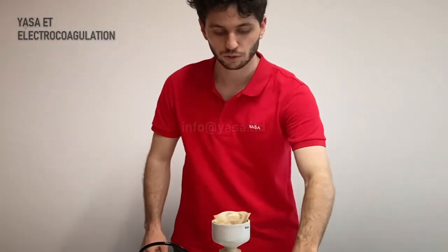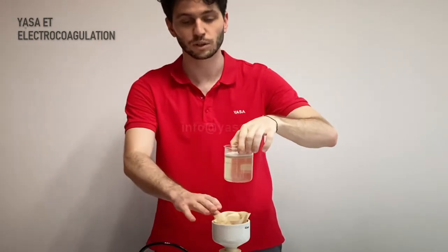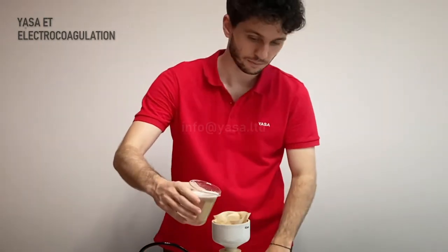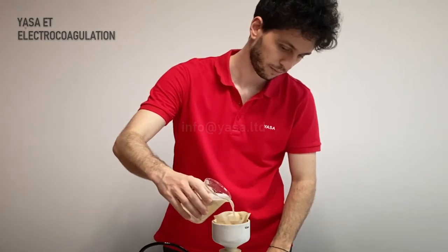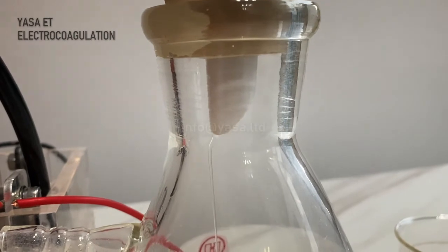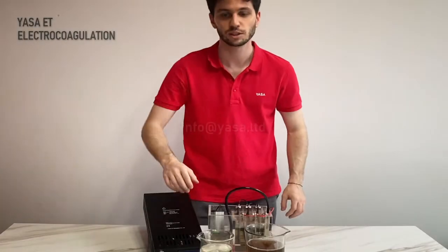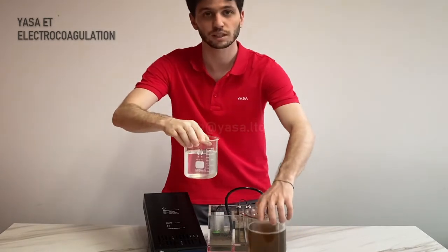Now that the treatment effect is finished, we took this water from this tank and we are going to filter it using this filter. This is the water after filtration, and this is the water we started from.